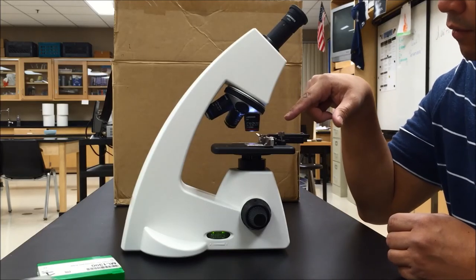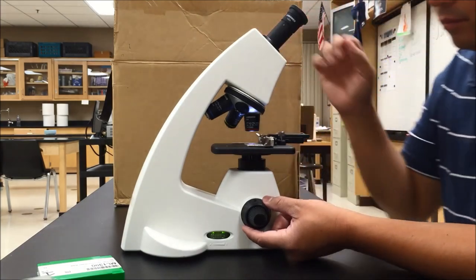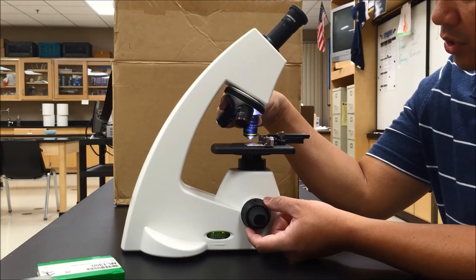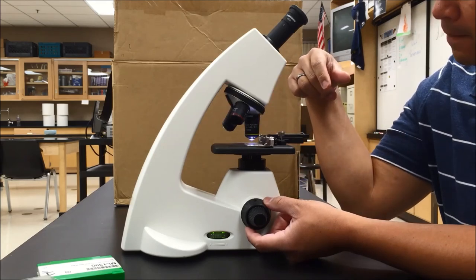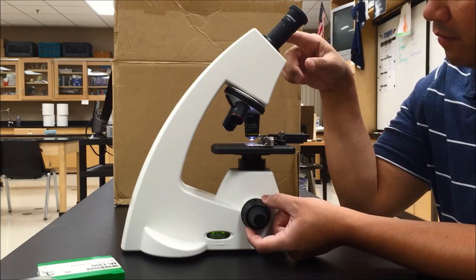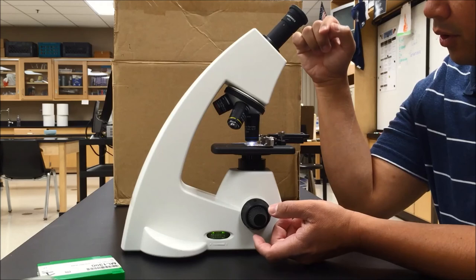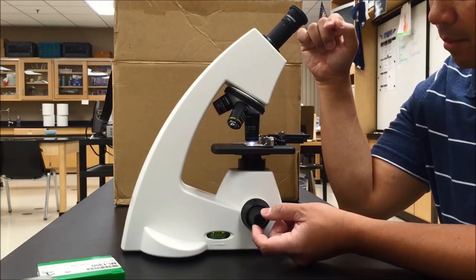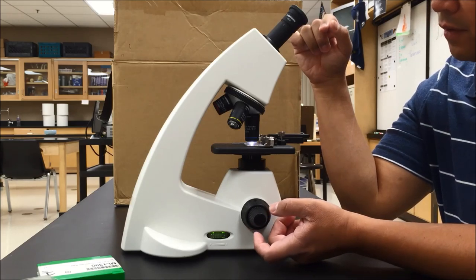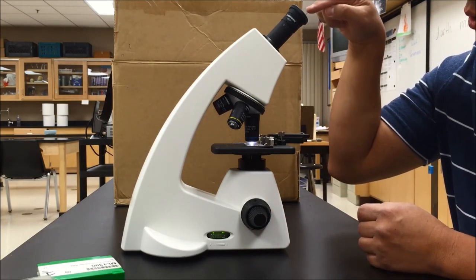Once you have your image centered in the field, begin under low power using the coarse adjustment knob to find the specimen. Once you've identified it and it is clear in your eyepiece, switch to medium power. Use the coarse adjustment knob again to sharpen the image. Once focused, switch to high power and use the fine adjustment knob to fine-tune your image so that it is perfectly clear. Once you have found your image, you will then be asked to take a picture of it through your eyepiece.